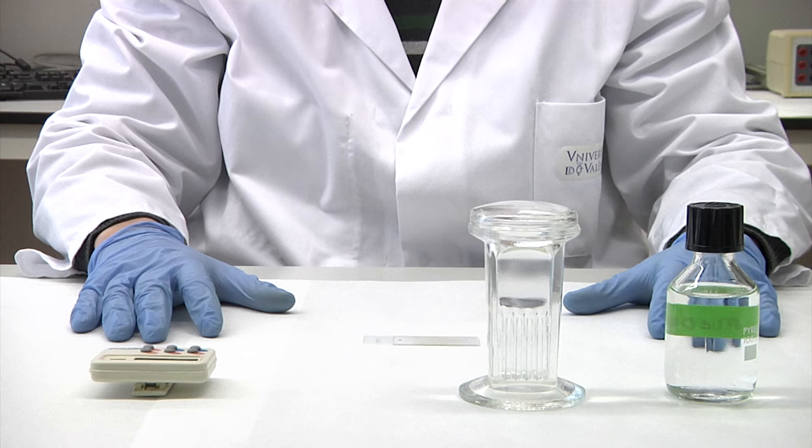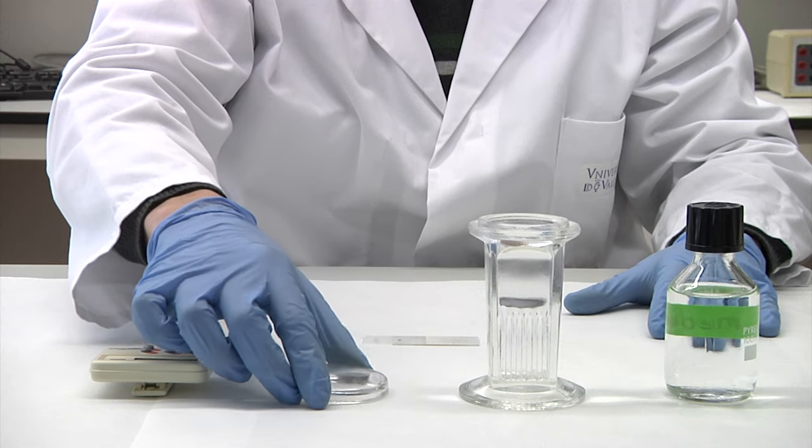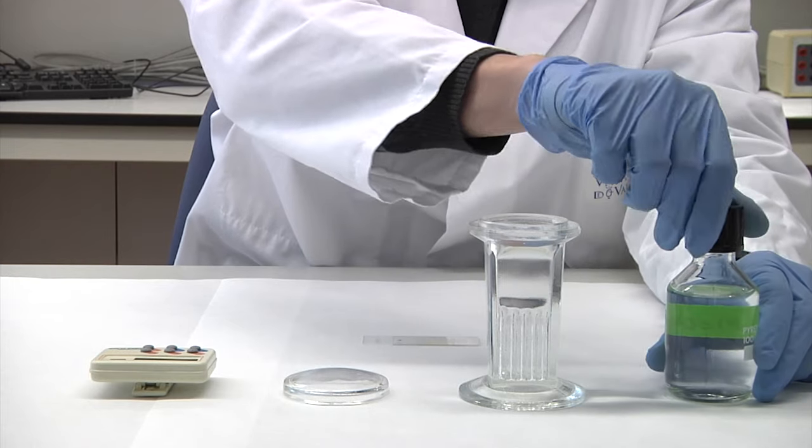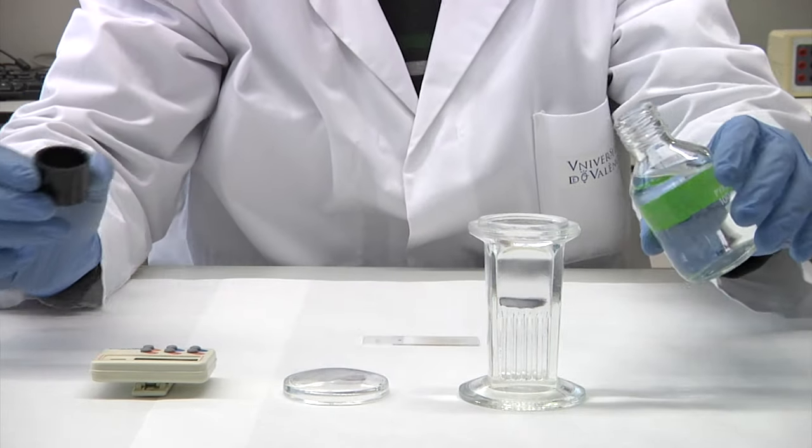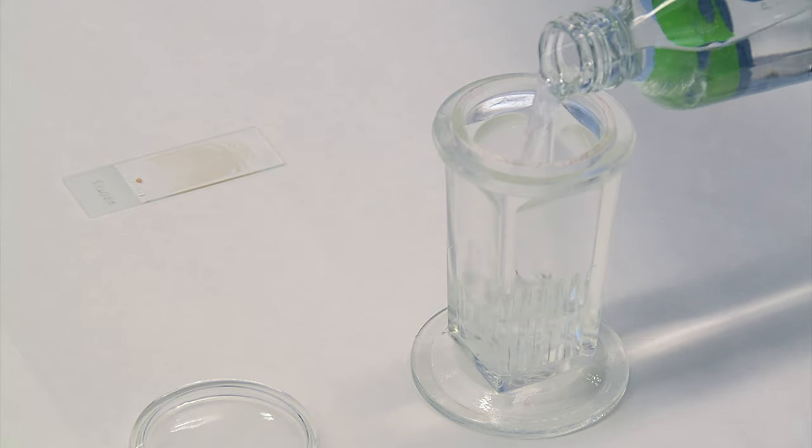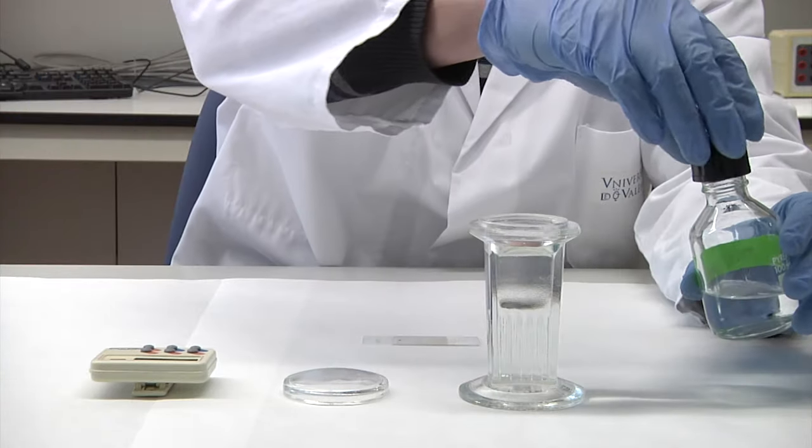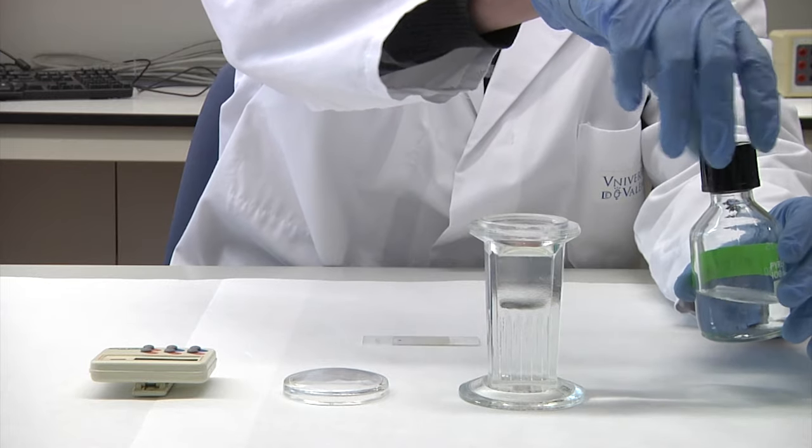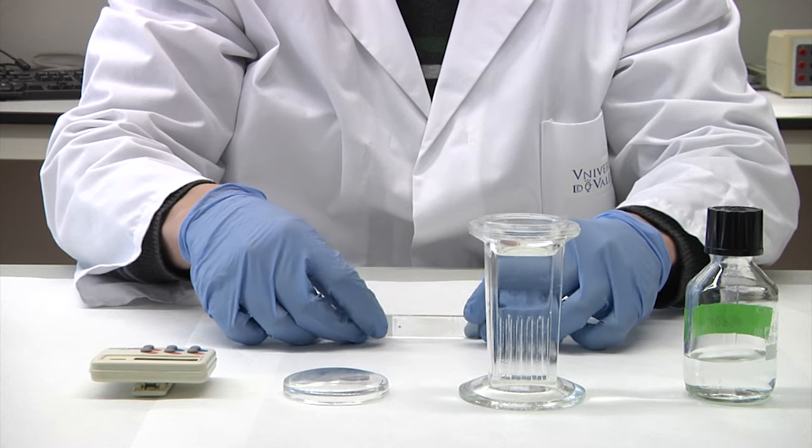The first step is to fix the sample. To do this, we submerge the slides in a bucket with absolute methanol and let it act 3 minutes.